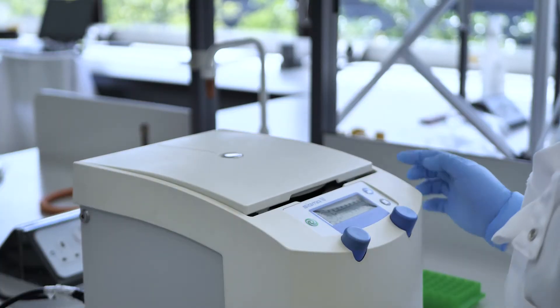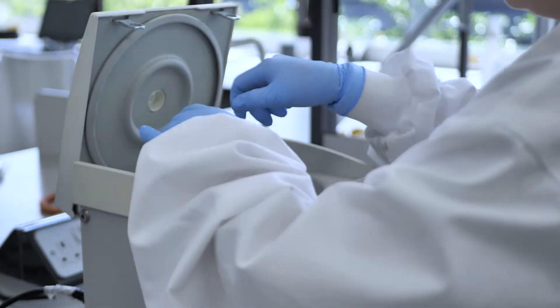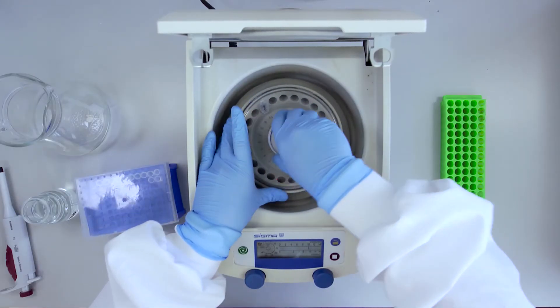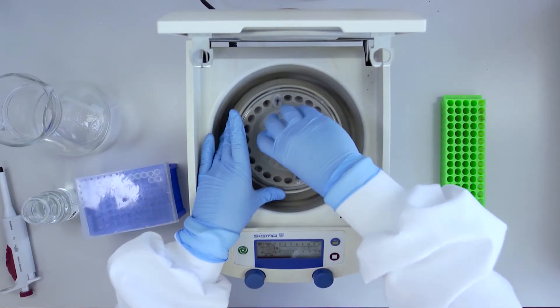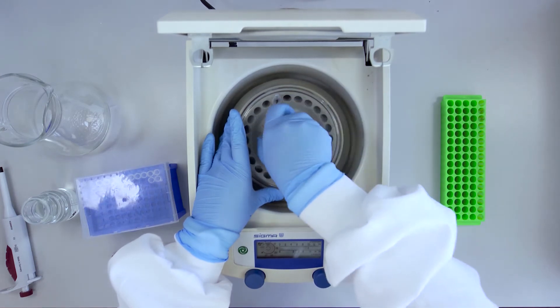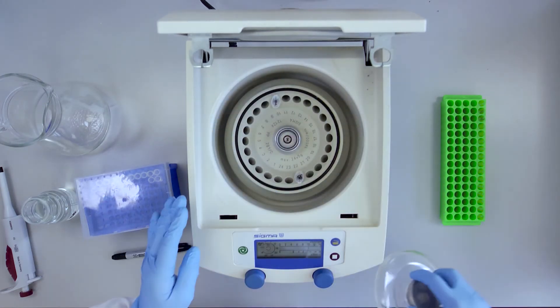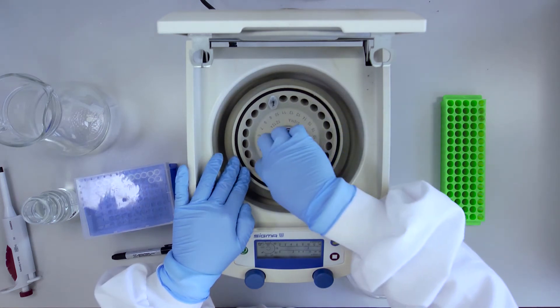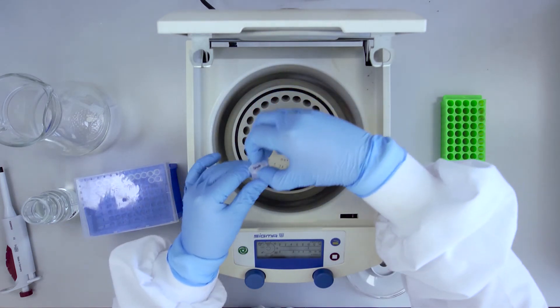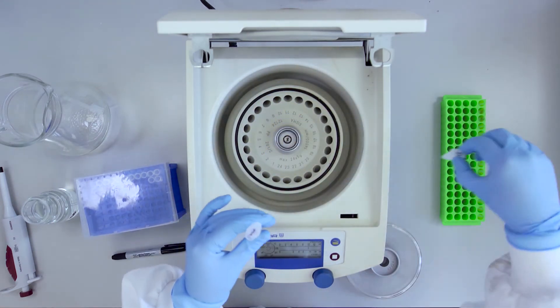Open the lid, remove the internal cover. Remove your samples and check that the rotor and interior of the centrifuge are clean and free of debris.